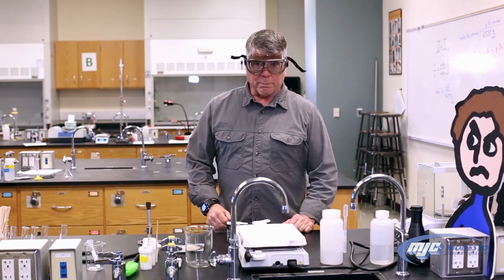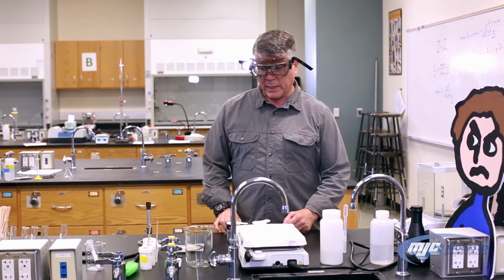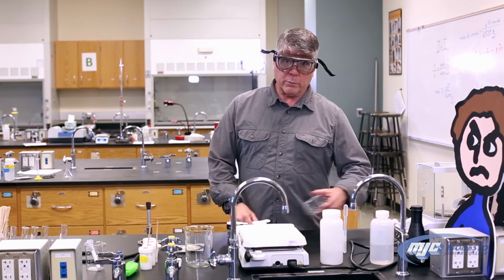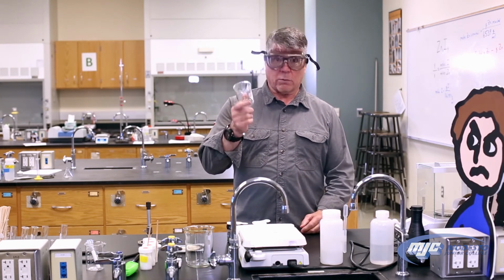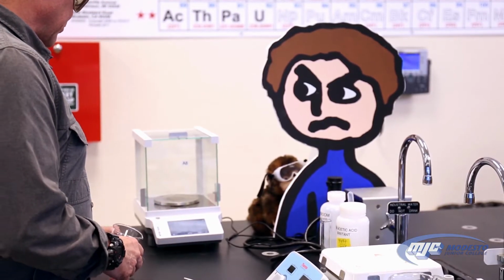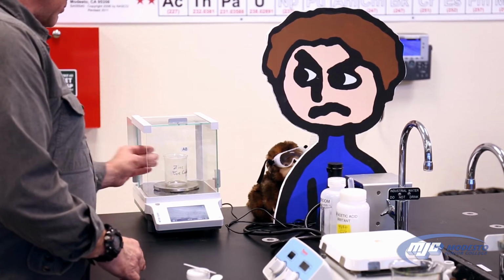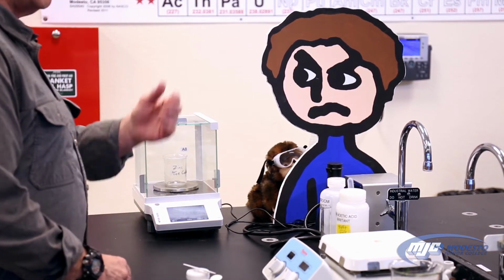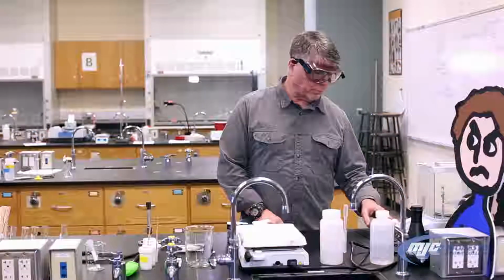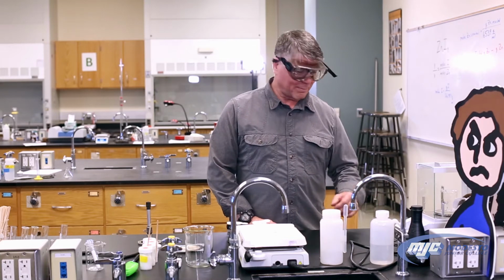All right, guys, so we're going to start the first part of the experiment, the synthesis of zinc iodide and determination of its empirical formula. First thing we need is the mass of your empty 150 milliliter beaker. So make sure the balance says 0. Place it on the balance, close the door, record that number, that goes in your data table. Then with the beaker still on there, we're going to tare the balance. Now it says 0 with the empty beaker on it.